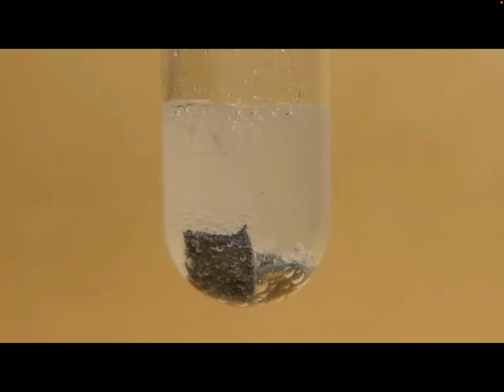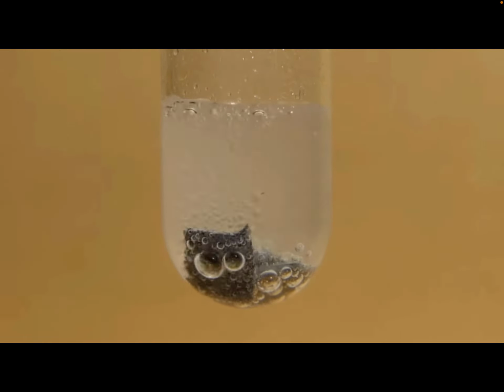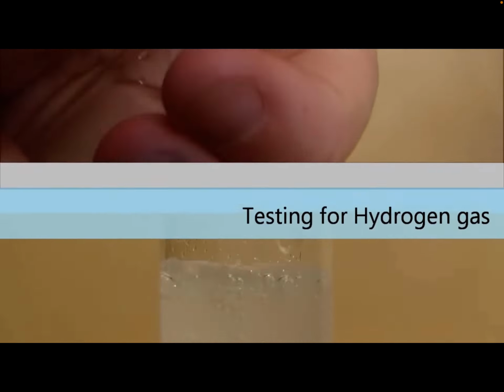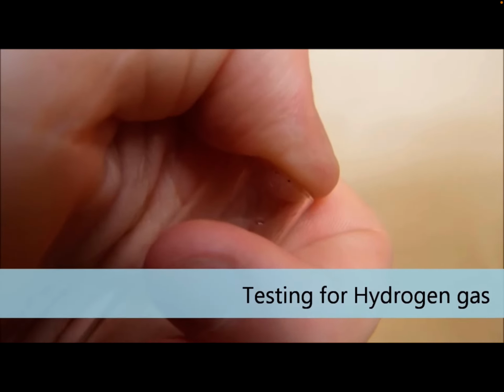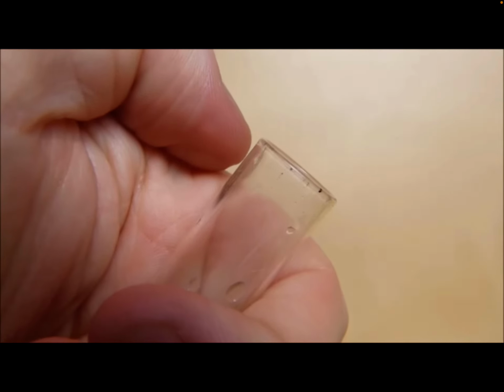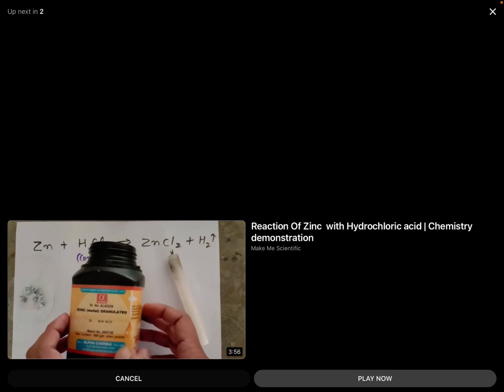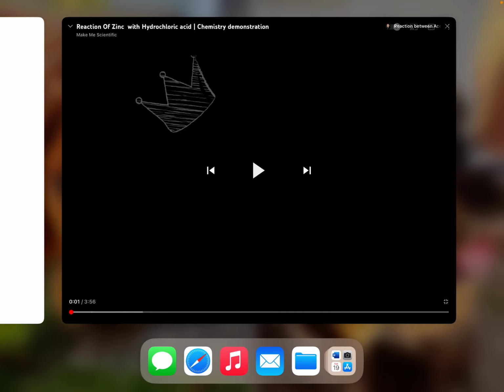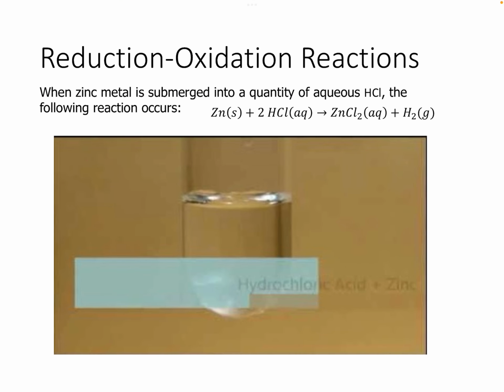Once this reaction's complete, they're going to do a test for hydrogen gas, and that involves putting a lit match into the test tube with the gas. So here they're about to do it. It actually will make a popping sound, and then the flame will go out. We'll do something similar in lab with magnesium and hydrochloric acid. It's really cool to see those reactions and to hear that popping sound.